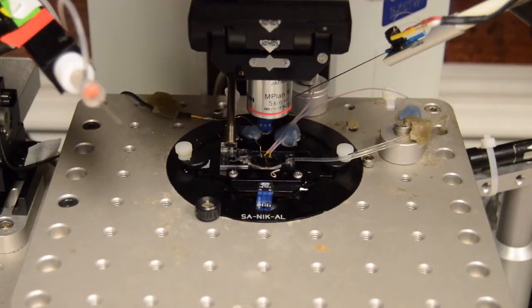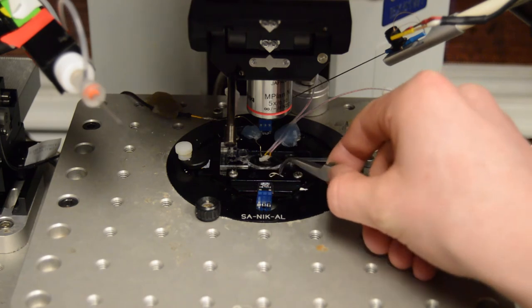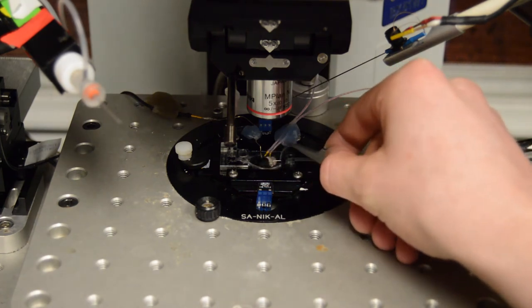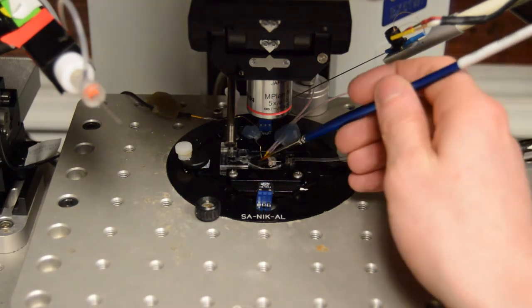We then can place the recording pipette onto the electrode holder of the patch clamp amplifier head stage and fasten it securely. We then can carefully place a brain slice into the recording chamber, and secure the slice using a weight, moving it around with a small paintbrush. Once the slice is placed, we can use the 5x objective lens to look at the dentate gyrus region, as shown, the cornu ammonis region, and lastly, the cortex. We can choose any one of these areas for our whole cell patch clamp recordings.